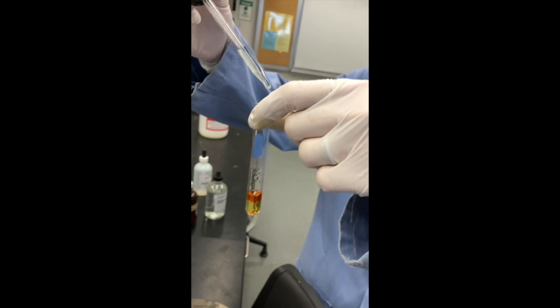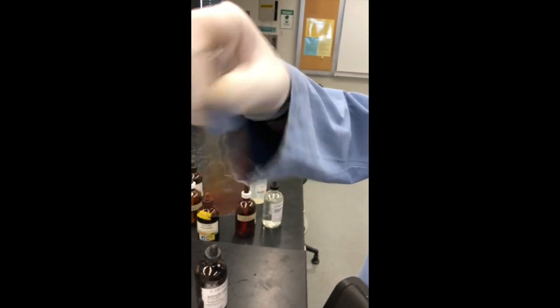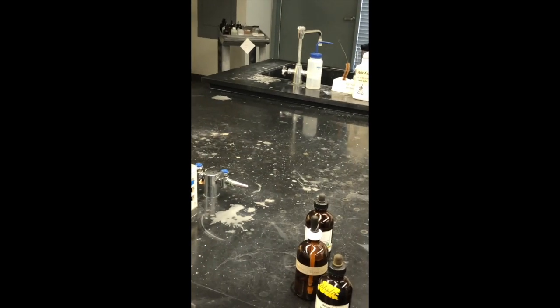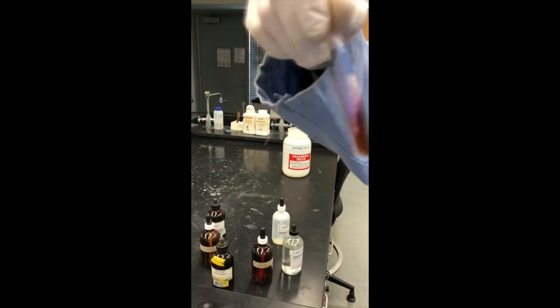Finally, we will add sodium iodide to each element. Sodium iodide to bromine — immediately the bottom layer gets very dark. The upper layer looks a little different but doesn't look like the color of any of the elements. We decided to add a few more drops of sodium iodide. After adding the full amount, you can now see the upper layer color clearly.